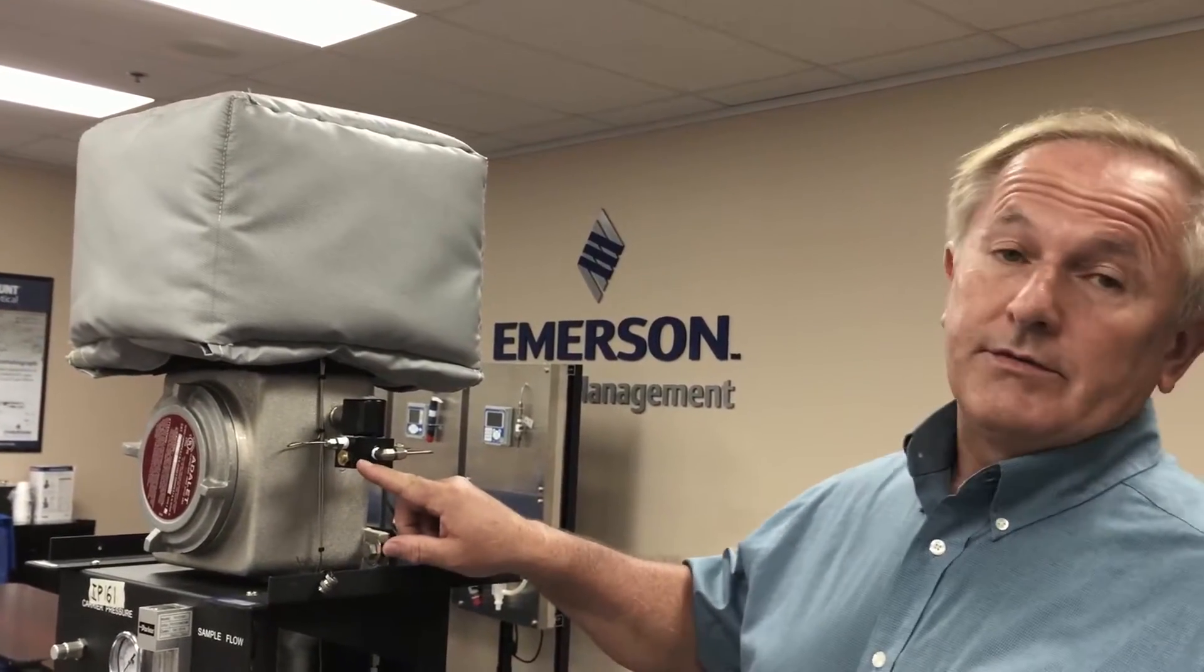The first is for safety considerations and the second is for improving the longevity of the Fabco valve. In order to perform this upgrade, you're going to need some tools and items.